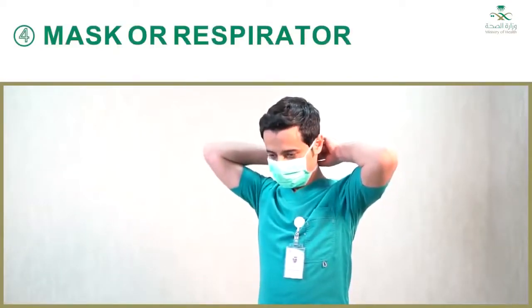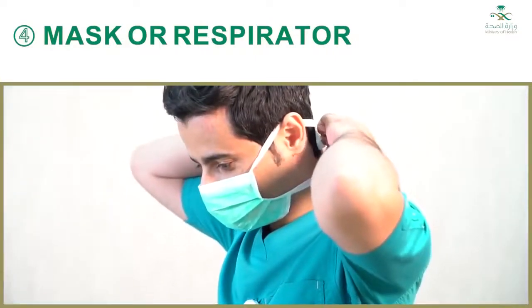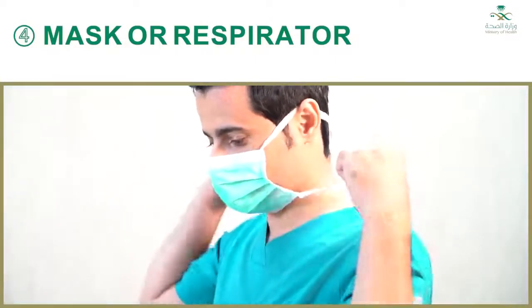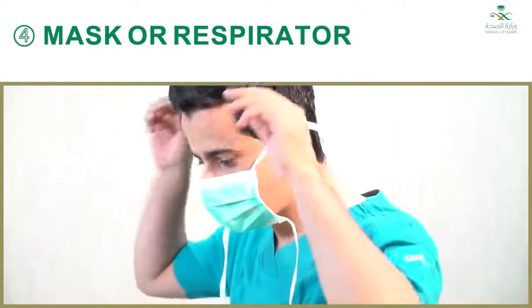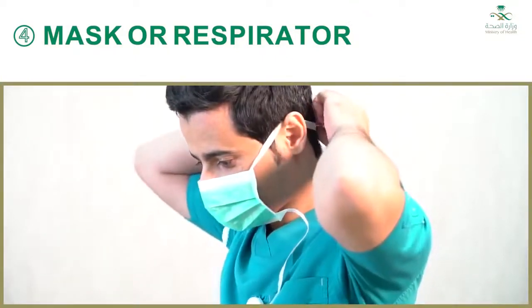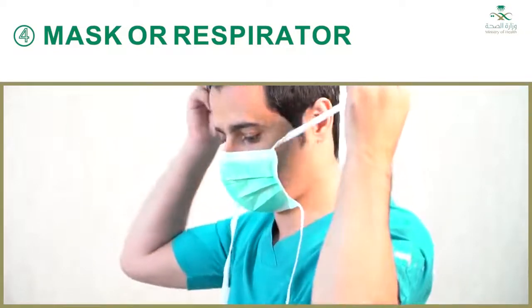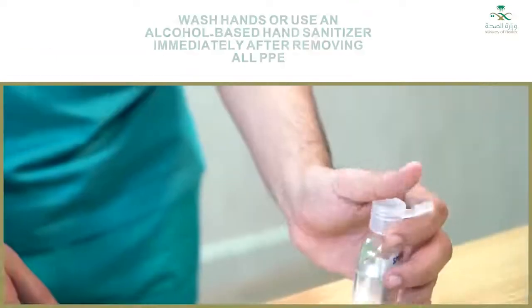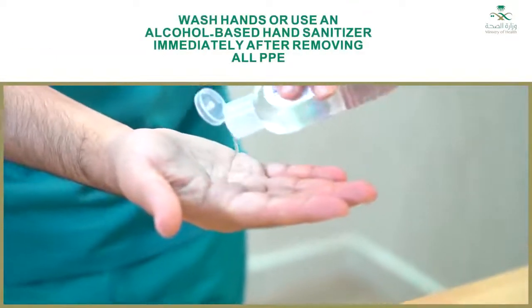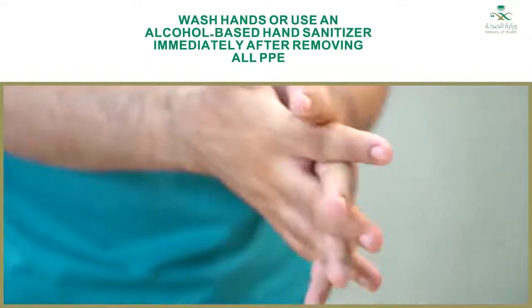4. Mask or respirator — front of mask or respirator is contaminated; do not touch. If your hands get contaminated during mask or respirator removal, immediately wash your hands or use an alcohol-based hand sanitizer. Grasp bottom ties or elastics of the mask or respirator, then the ones at the top, and remove without touching the front. Discard in a waste container. Wash hands or use an alcohol-based hand sanitizer immediately after removing all PPE.